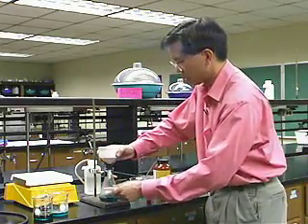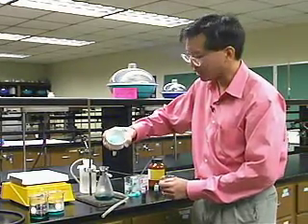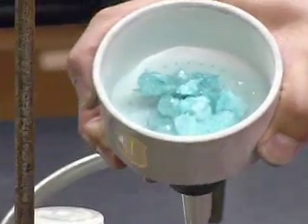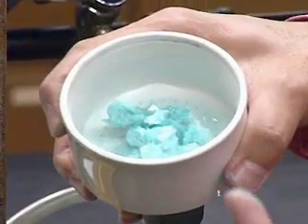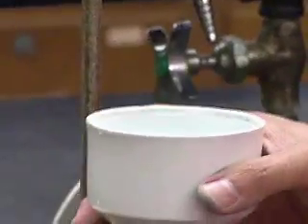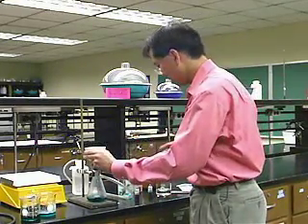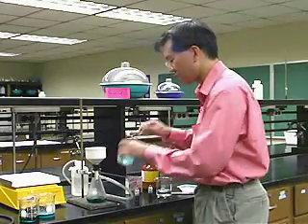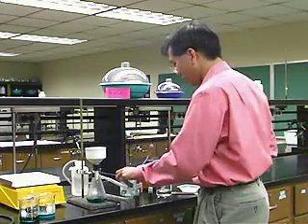At this point, it looks like crystals that are pale blue. And why they're pale blue is not because the blue is incorporated into the crystal. Again, the crystals are fairly pure. The blue is coating the crystals. So what we're going to do is take a little bit of water and rinse these crystals, and we're going to lose a little bit of product. Obviously, I could have done a better job of getting the rest of this out of here, but I'm just trying to illustrate the point here.